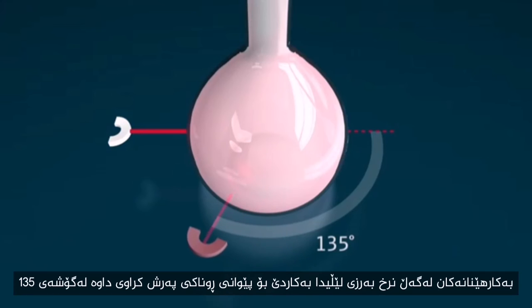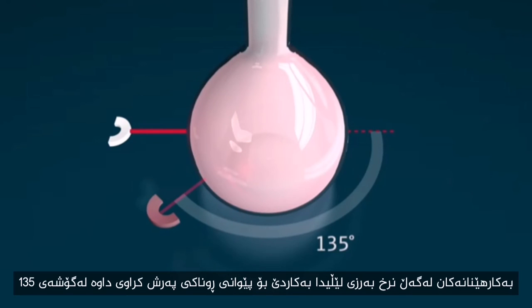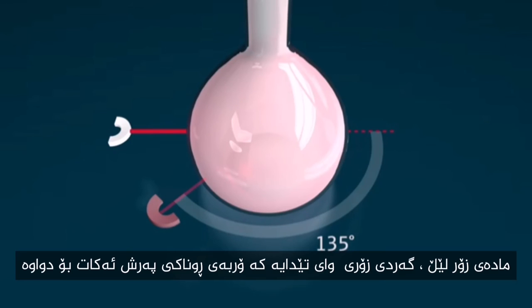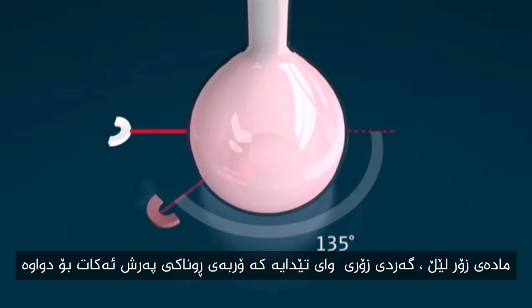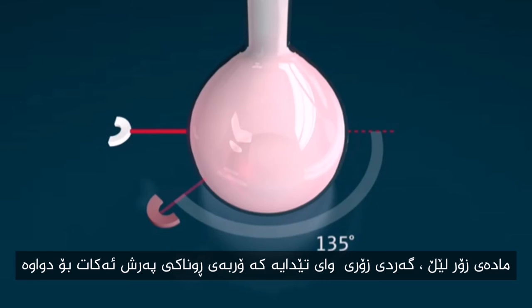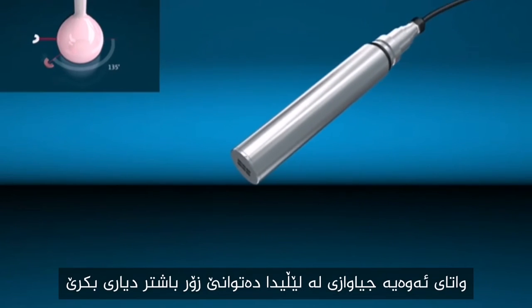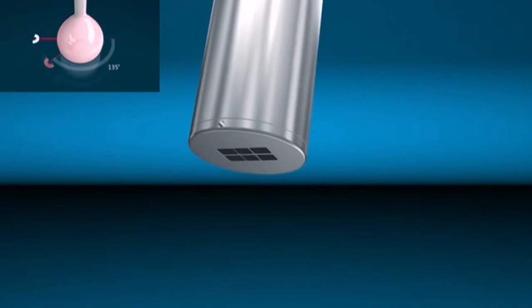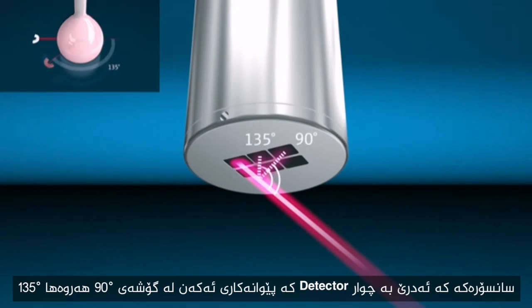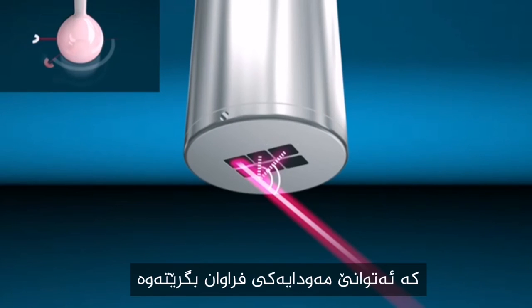In applications with higher turbidity values, sensors are used that measure backscattering at 135 degrees. Very turbid media contains so many particles that the main part of the light beam is backscattered, meaning differences in turbidity can be detected much better in the backscattered light. Sensors equipped with four detectors, measuring at 90 degrees and 135 degrees, are able to cover a wide measuring range.